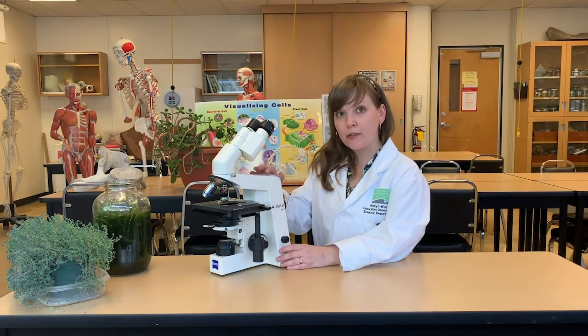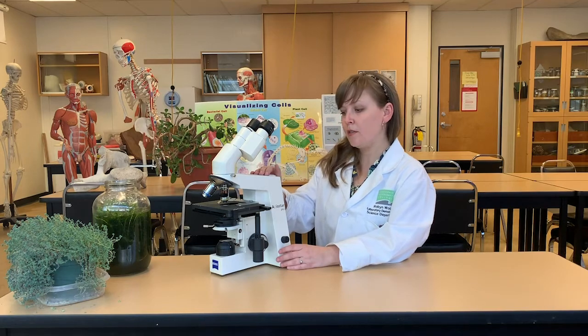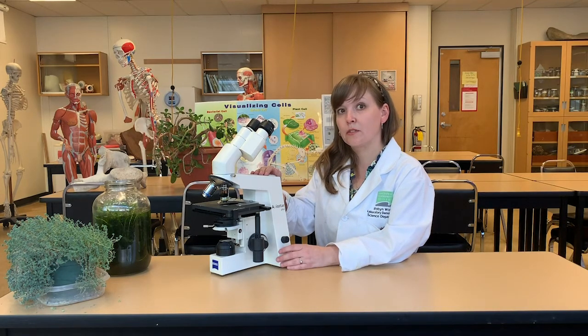Hi, I'm Robin, a lab demonstrator here at Vancouver Community College. Today I'm going to go over with you how to use this Zeiss Axiostar Plus compound microscope.